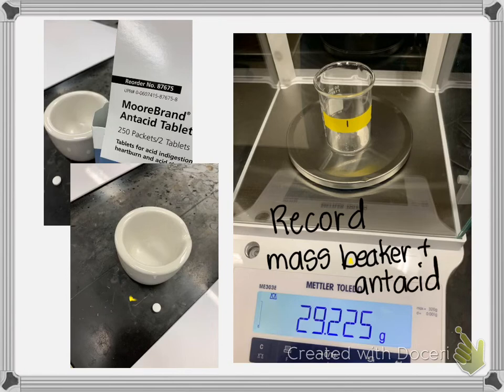Oh, and before I forget, I did measure, even though I didn't take a picture. I apologize, I had a lot going on. I wrote down the mass of the tablet. Here, the mass of one dose, which I used as one tablet since that's what the active ingredients correspond to.